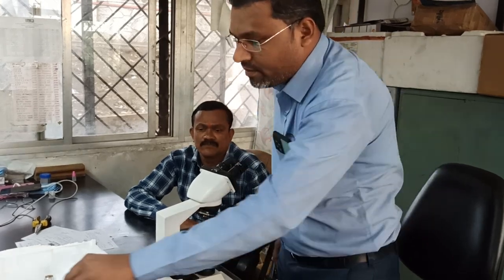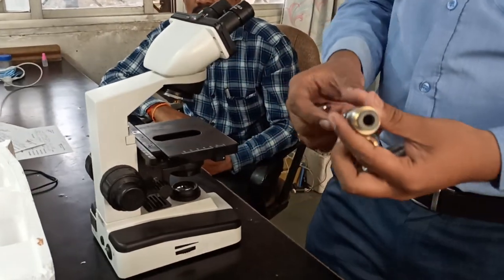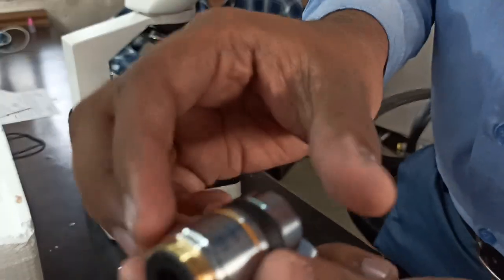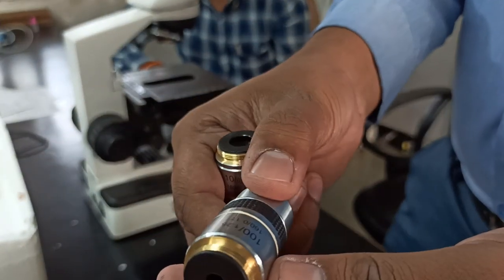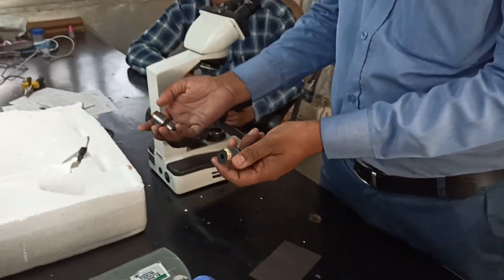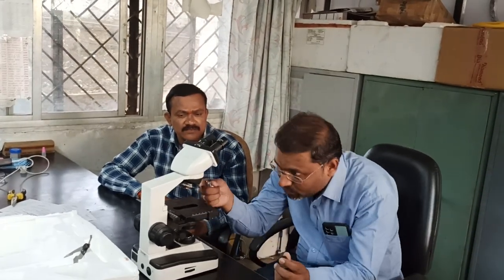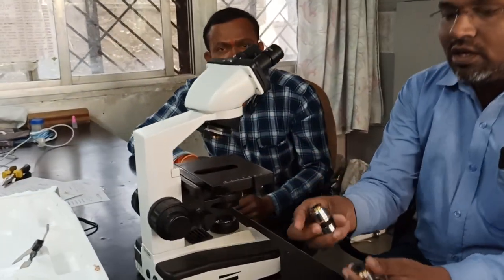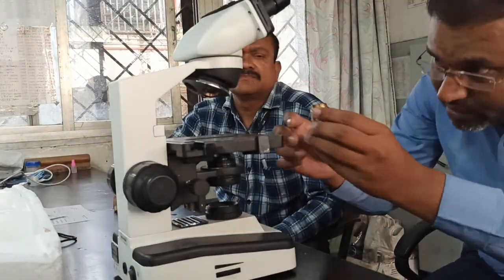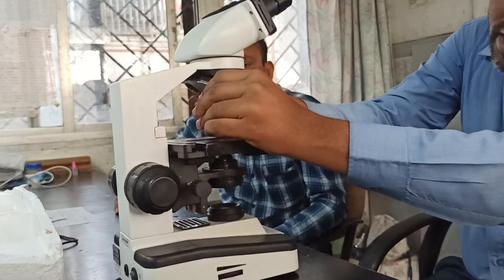Okay. Next thing, the company has provided these four lenses with the microscope. You can see, for the different visions, this is 10x, low power, right? This is 40x, and these are 100x oil immersion lenses. How to fix them: you can observe there are four slots provided at the bottom side, and these are the threads. You just have to fix it like this. Okay, just rotate it properly.